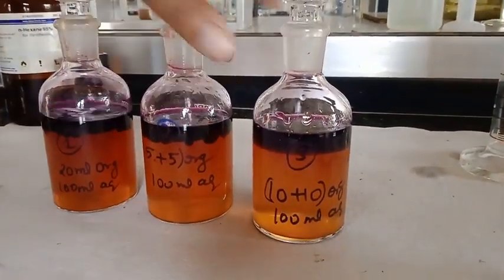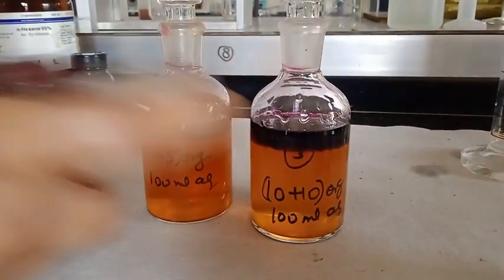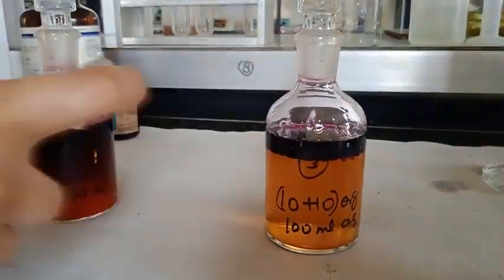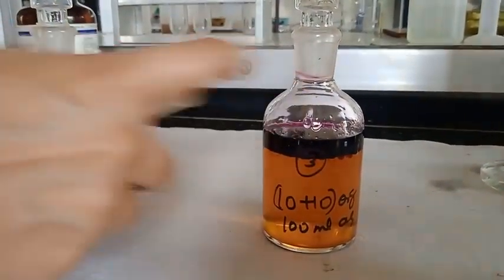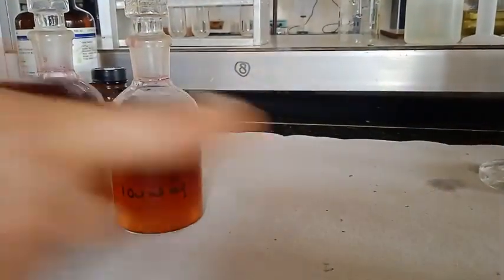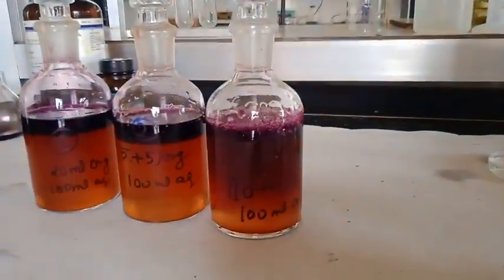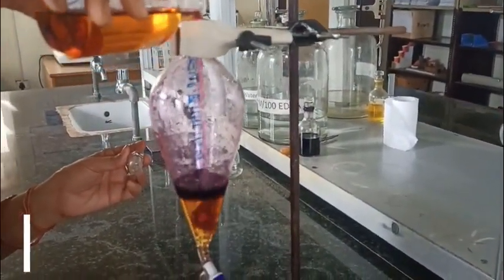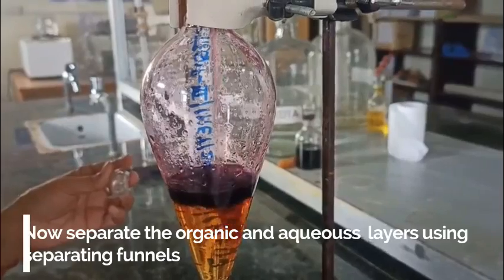Repeat the same shaking procedure after every 5 minutes for 30 minutes. And once you complete the procedure for 30 minutes, leave it at room temperature for at least 30 minutes, and then separate the organic and aqueous layer.